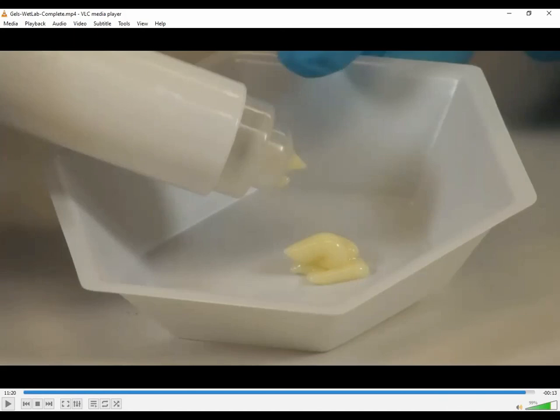So part of what you got to do is not only bring us over your completed AccuPen with your beautiful product in it, but your completed worksheet that you've also then determined and calculated the volume for each one of these squirts. And I'll be honest with you, you don't have to use an AccuPen.